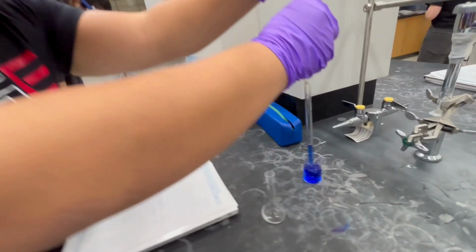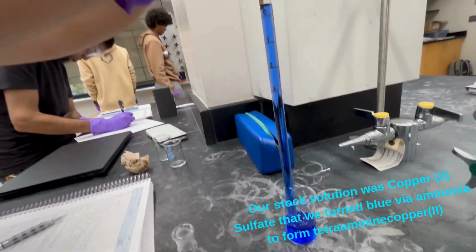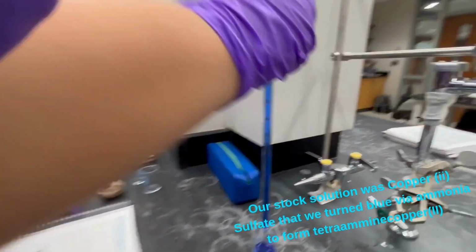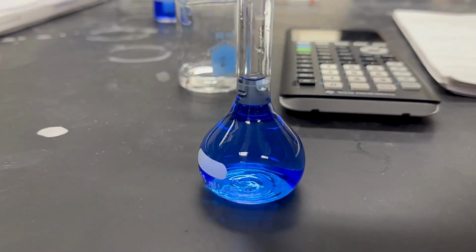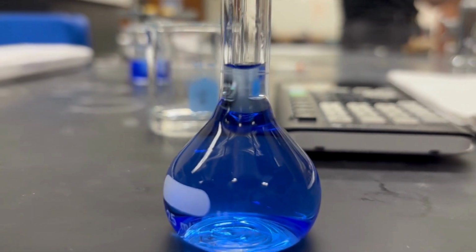To start our experiment, we draw the solution slightly above the calibration line using the pipette bulb. We then release slowly, until the bottom of the meniscus just touches the line at eye level. After transferring the solution to a 25 milliliter volumetric flask, we add distilled water dropwise until the meniscus reaches the mark on the flask.